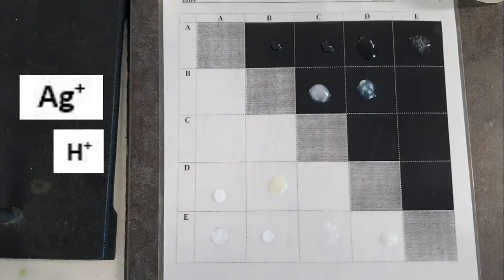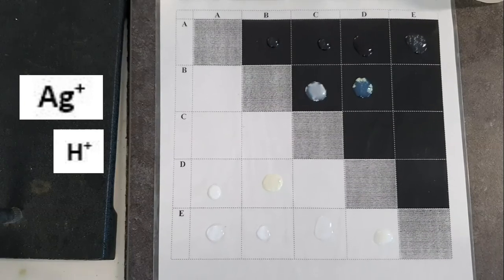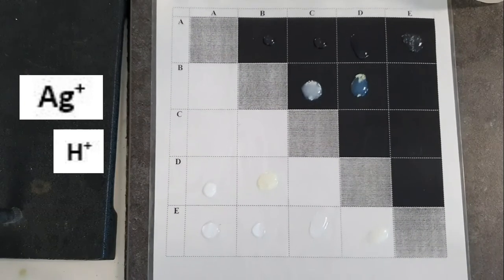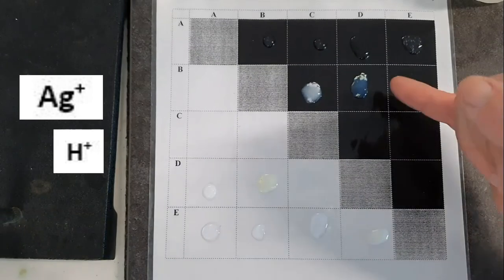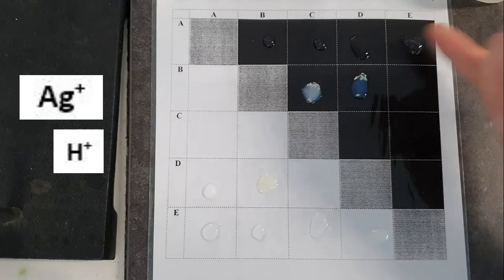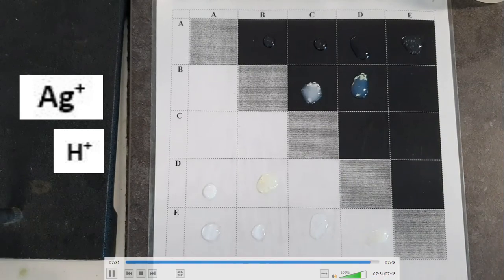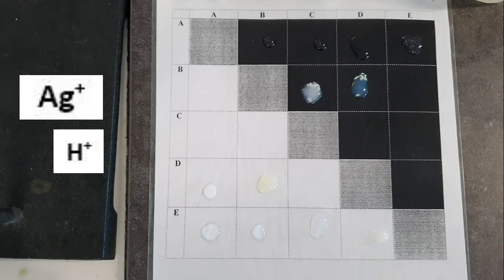I'm giving that a bit of a shake just to make sure that the reagents mix. Well, that looks as if some of it's dissolved. The other ones there clearly are dissolved. This one here hasn't really dissolved. Still plenty of it there, so maybe partly dissolved there. And now the task is to identify what the anions, the negative ions, are in each of those solutions.